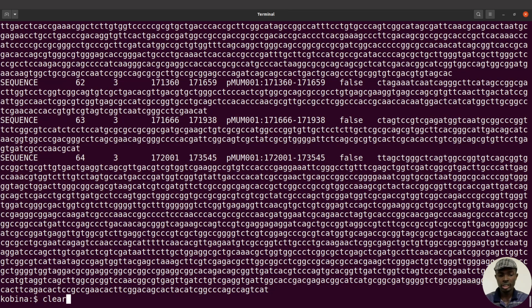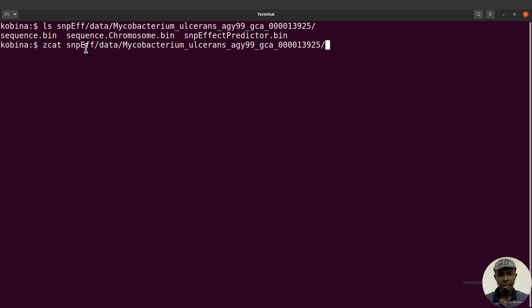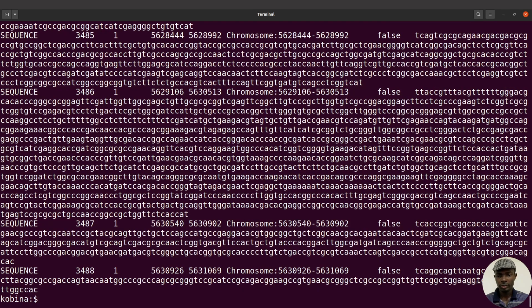So what we are going to do next is to check this one also, because this one says sequence of chromosomes. So that means definitely what we are looking for will be here. All right, so we still need to do the zcat, then specify the file, and this time we say sequence.chromosome.bin, like this. So let's execute this command. Perfect, so we have executed it.